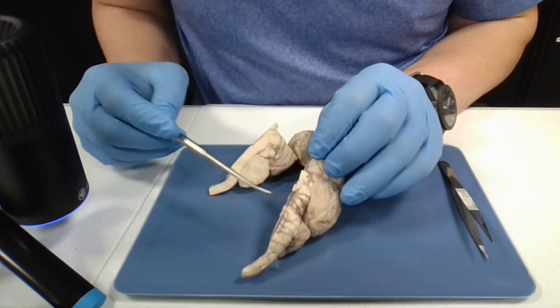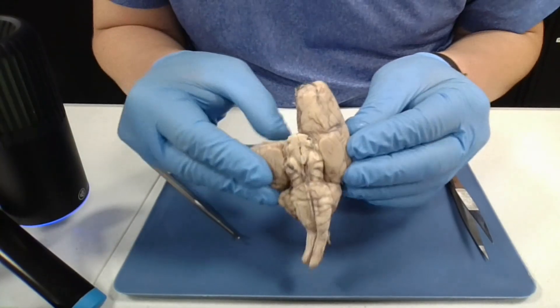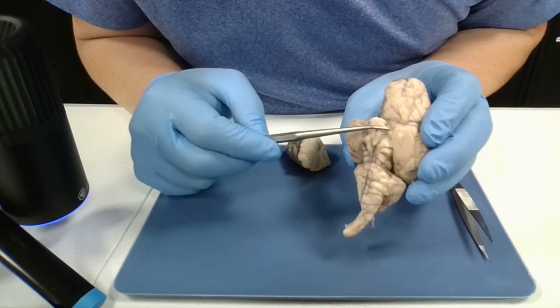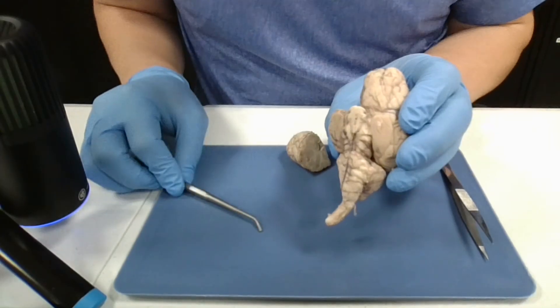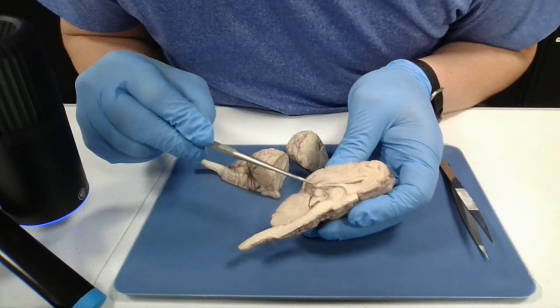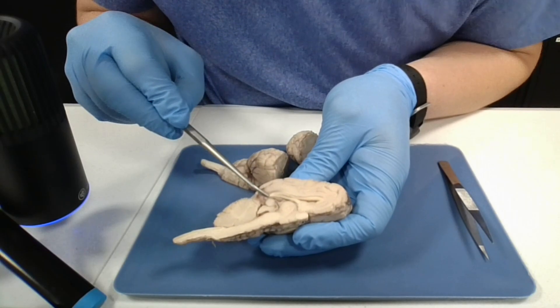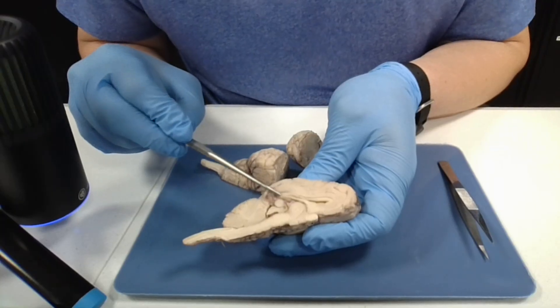The next thing I want to show you is the optic chiasma. I'll put these together to make it a little bit easier to see. You can see this pattern here that kind of looks like an X — the nerves are cut off here, but this is where the optic nerves can switch sides. Next, I want to show you the corpus callosum, which is this white band here, and that connects the two cerebral hemispheres so they can communicate from one side to the other.